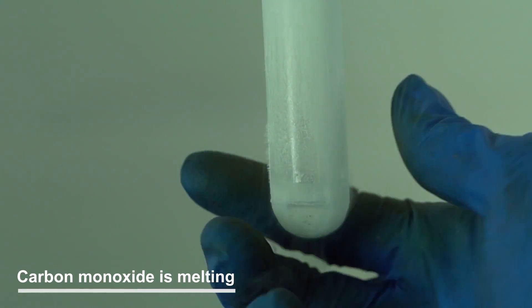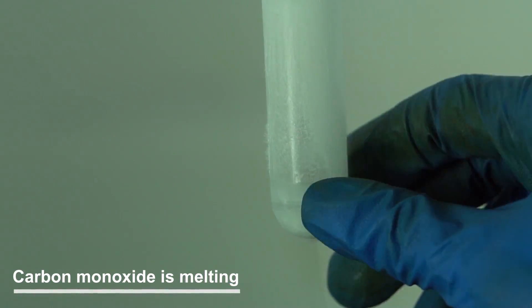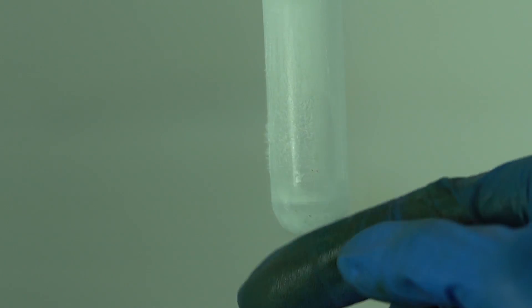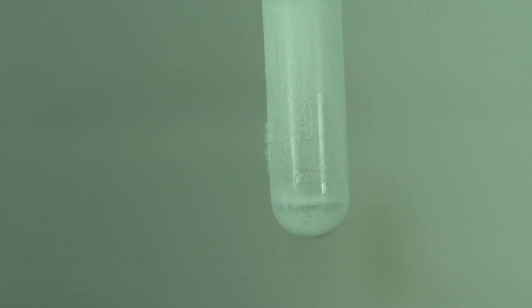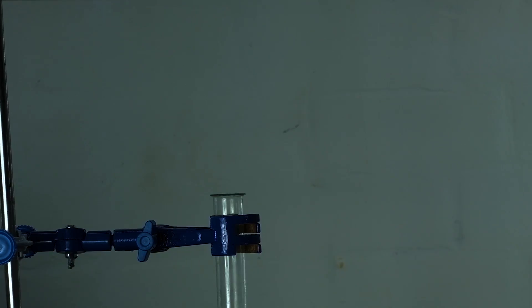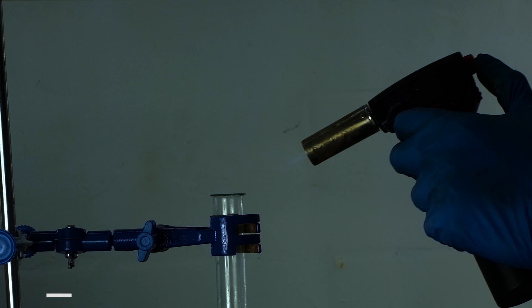This solid carbon monoxide melts, so you can see a seeming cloudy precipitation. In air, carbon monoxide burns with a calm blue flame.